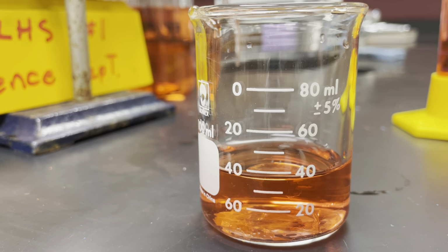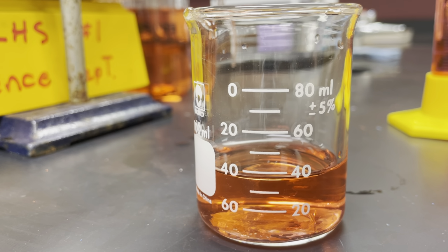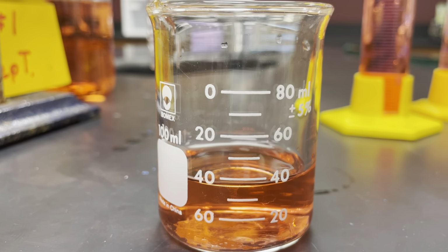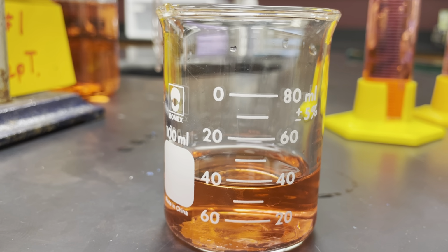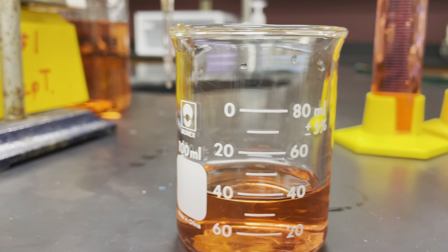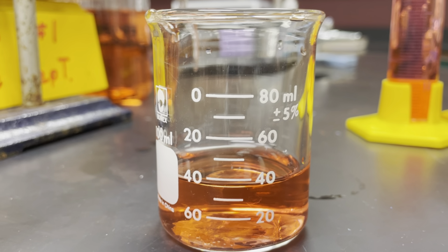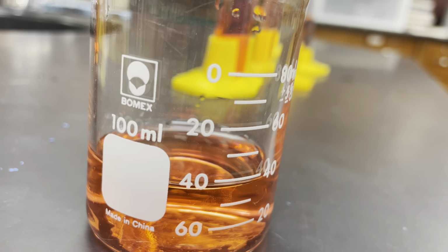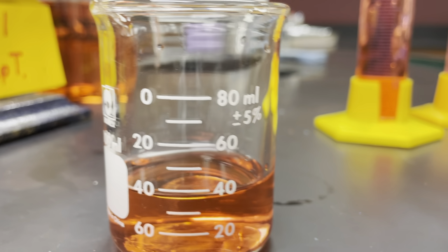On the right side, this 20, 40, 60, 80 is counting up in milliliters, how many we can contain here. On the left would be sometimes marked as TD, or to dispense, so how much volume you are letting out as you pour some out and you recheck the number. Most of the time with glassware like this, we're looking at how much liquid's contained in it. And this beaker can hold up to 100 milliliters, but that doesn't necessarily mean it measures up to 100 milliliters. You notice that the marks stop at 80.